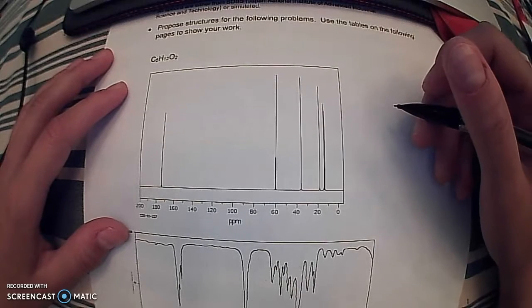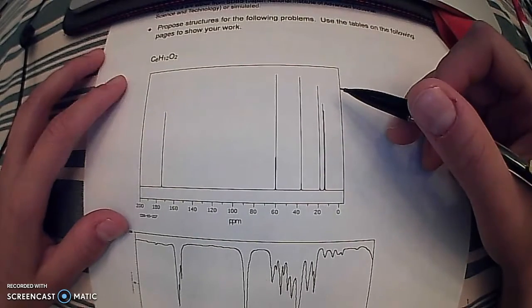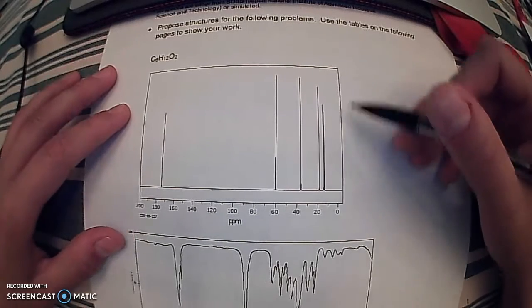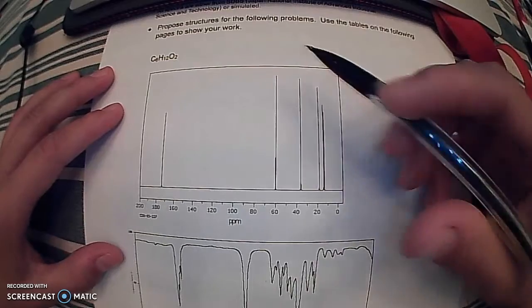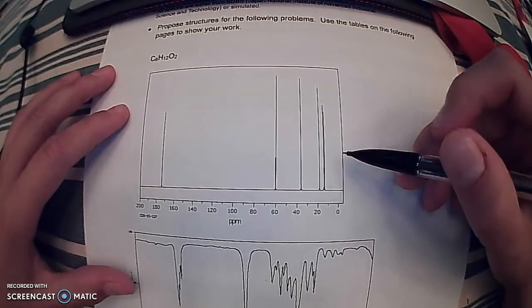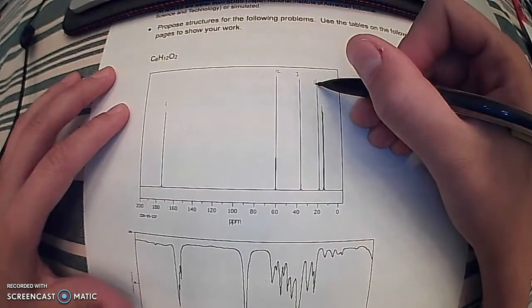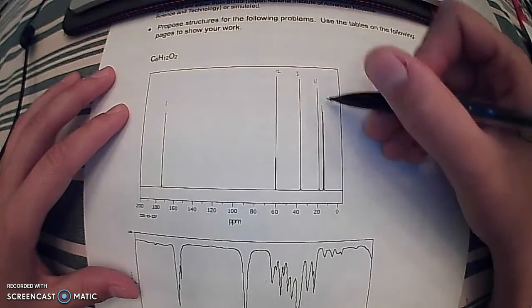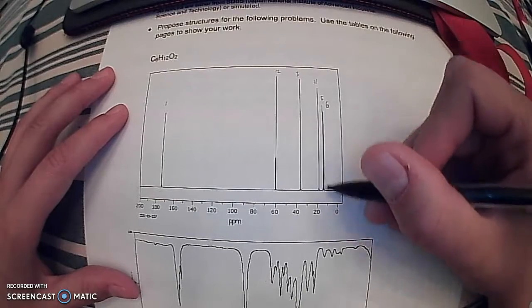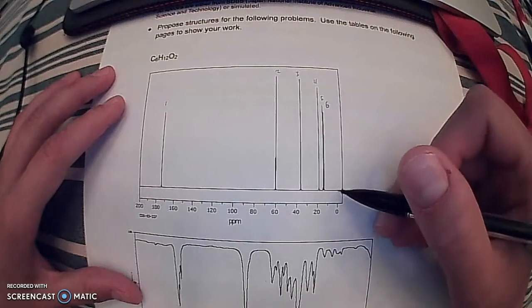All right, starting out here with our first step with our carbon-13 nuclear magnetic resonance, looking at the carbons. Outright, we can see we have a scale from 0 to 200 parts per million, and we can see 6 peaks here. 1, 2, 3, 4, and then there are actually 2 over here, 5, and 6. Even though they almost look like they're one, there are 2 distinct peaks. It's very subtle, but it is definitely there.